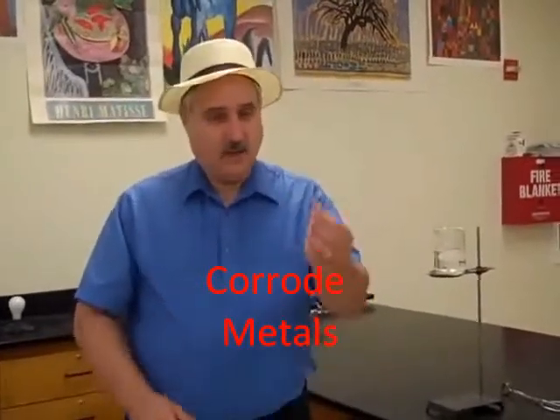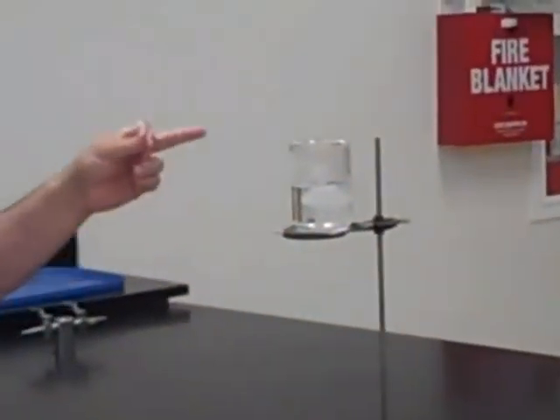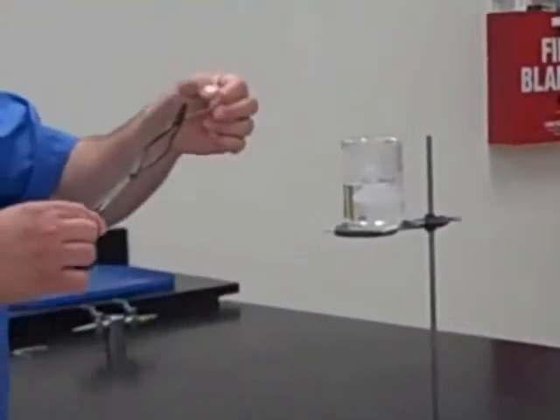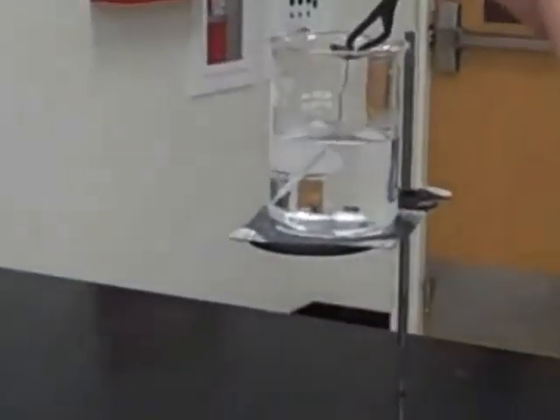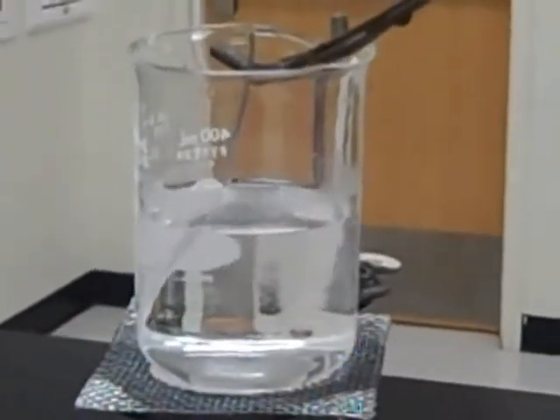One last property I want to look at is the fact that acids tend to corrode metals. Here we have a piece of magnesium ribbon, a thin wire made out of pure magnesium. Here we have a beaker containing hydrochloric acid and water. I'm going to dip this in there and see what happens. So if you come over here, put that in there, and let's see what happens to the magnesium in the hydrochloric acid. You can see that it's fizzing, it's giving off hydrogen gas, and the metal is going to corrode.